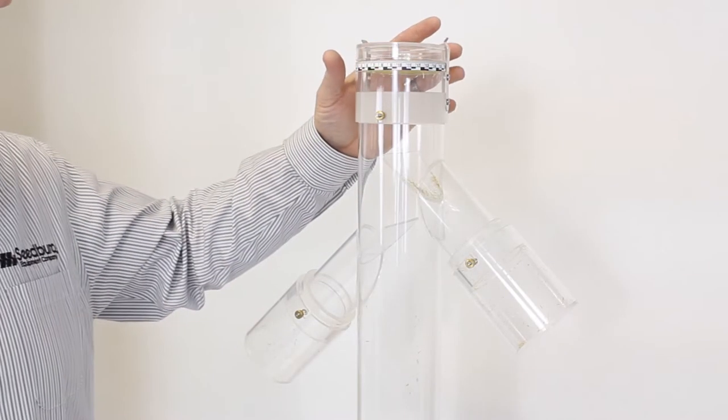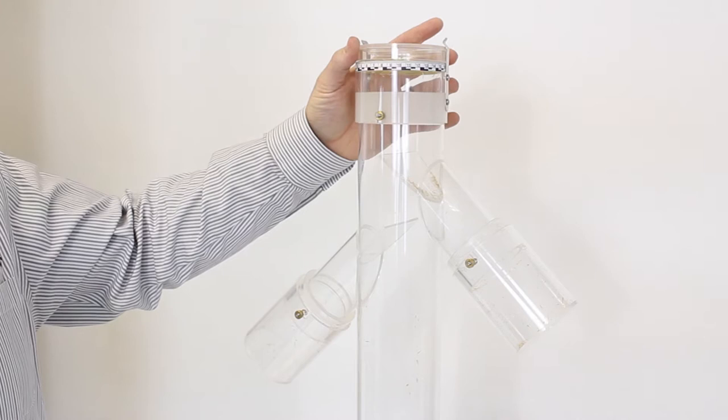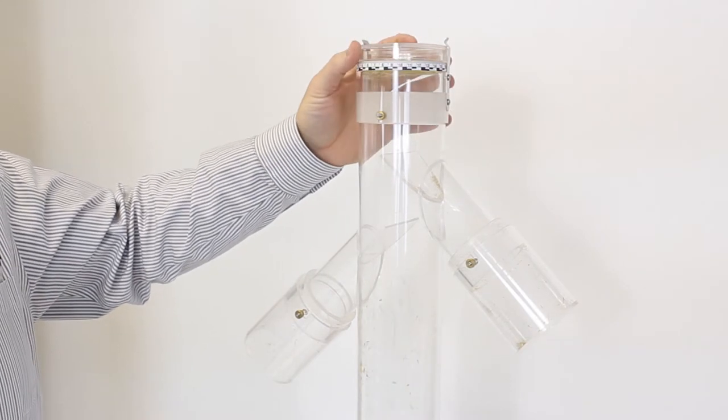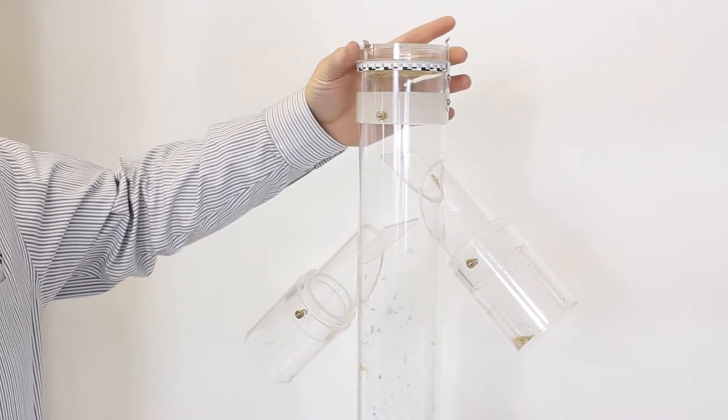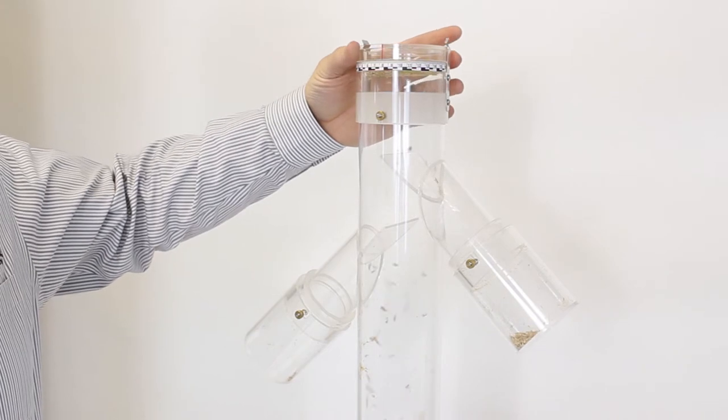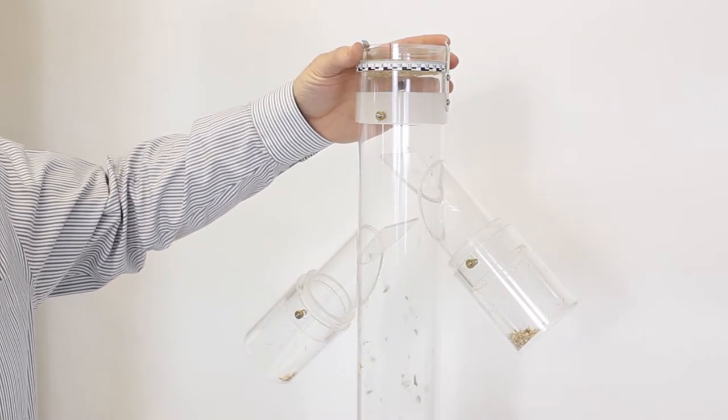Then I'm going to adjust the calibration valve cap until I get a good separation between the heavy seed and the lighter dust and debris and chaff.